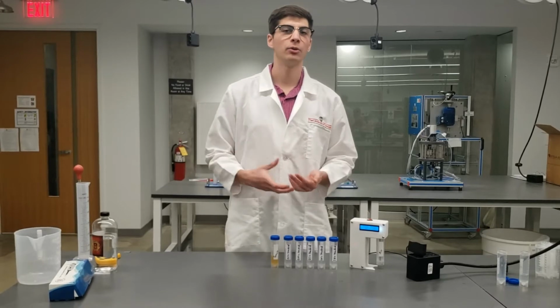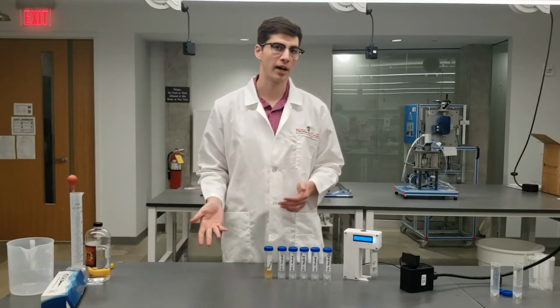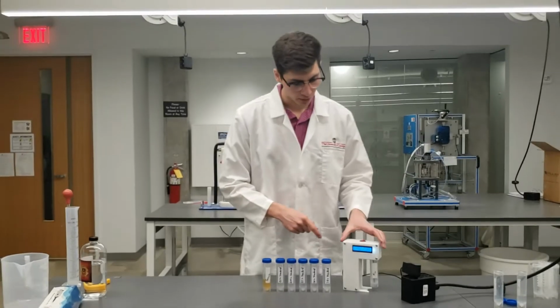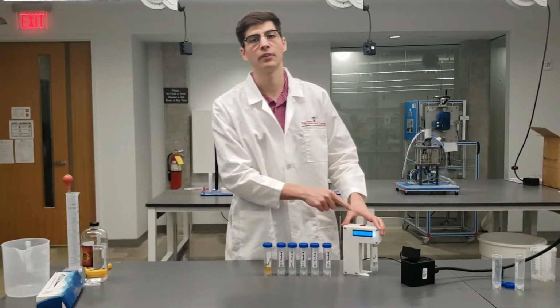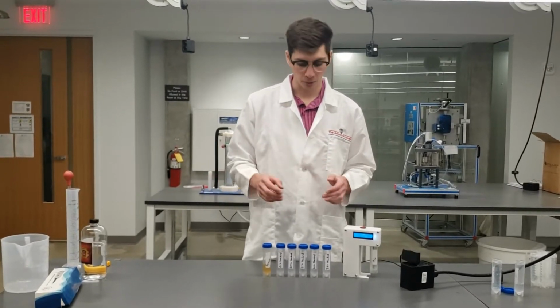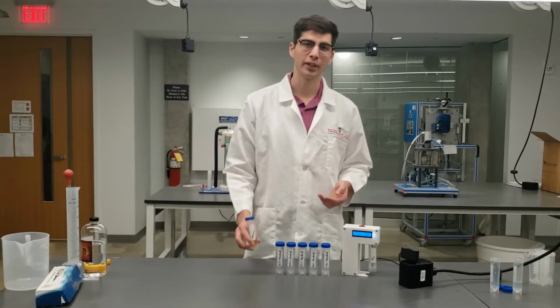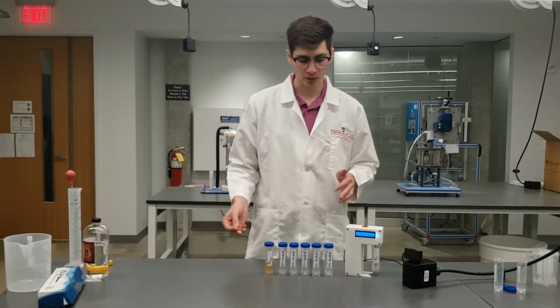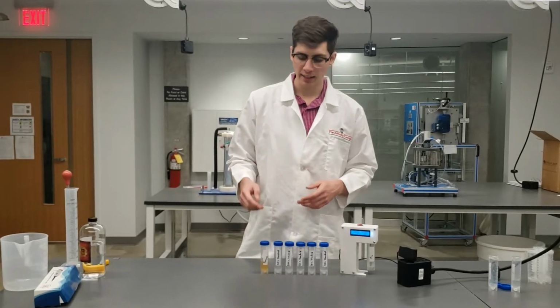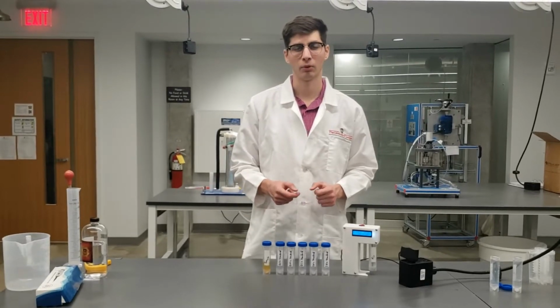You'll also need a computer and an Excel document that allows you to create the calibration curve, which I can provide upon request. So as we go through with the different samples, we'll be using the raw reading on the screen of the detector and insert those numbers into the Excel document in order to get a calibration curve for the detector. Now, once we have the calibration curve, we can read as many unknown samples as we want, so long as they're at the same temperature as our standards were. And then we can use the calculator in the Excel document in order to find what that raw reading is in the unknown sample or samples.